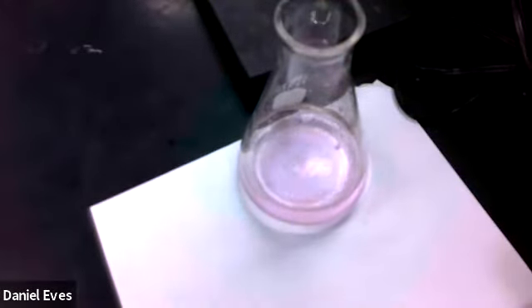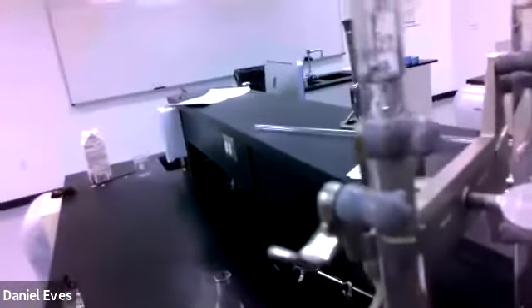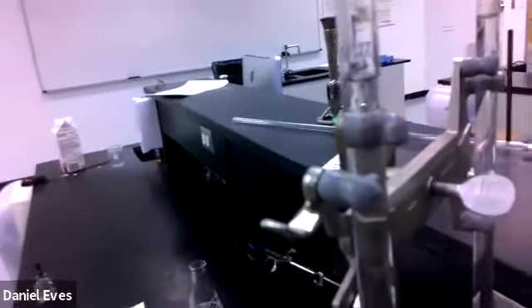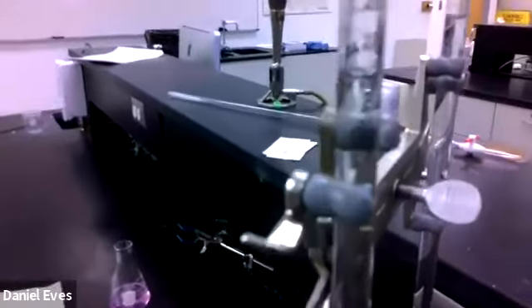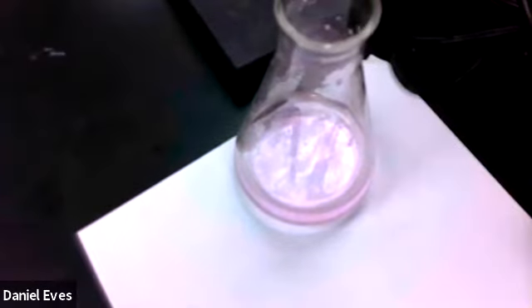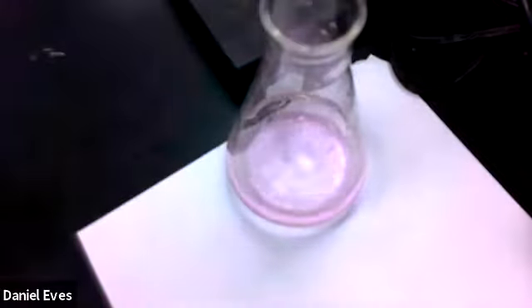Let's come up here and look. And I'm going to take you with me here. There's our lovely pink. It's staying there pretty good. So we come up here and we are at, oops, too close. A little less than 27, so more than 27, I should say. So it's not focusing for me. It's 27 point, if I'm guesstimating that, 0.7. 27.7 is what I would say that was. And so that's what we would record for our second titration, 27.7. So we started at 0, so we dispensed exactly 27.7 milliliters of our sodium hydroxide.